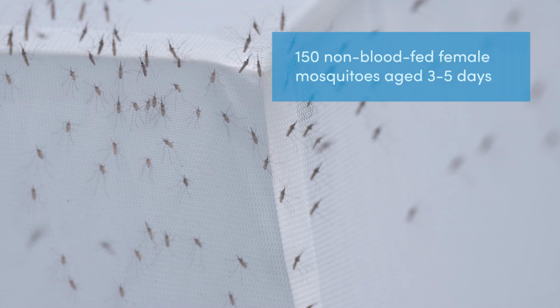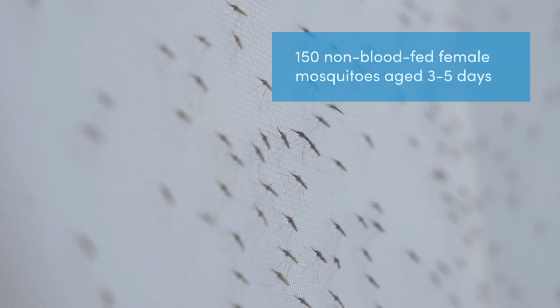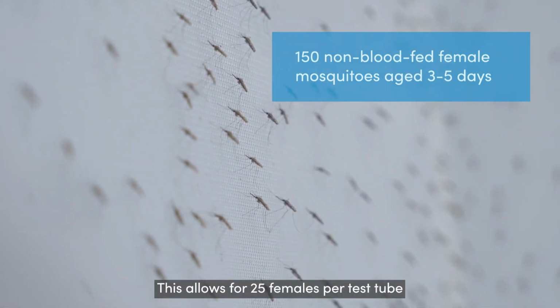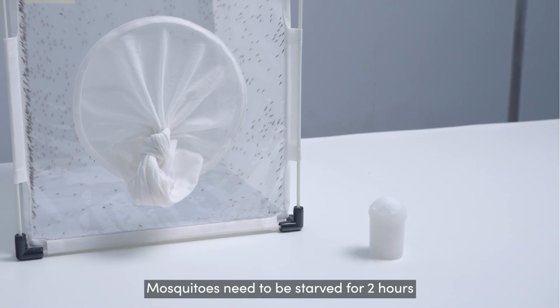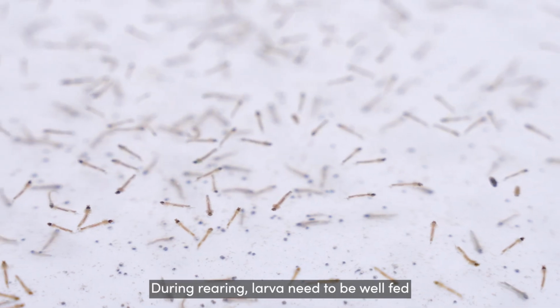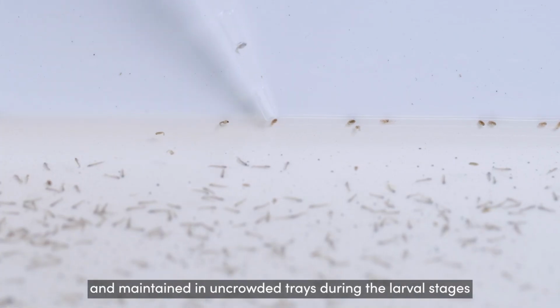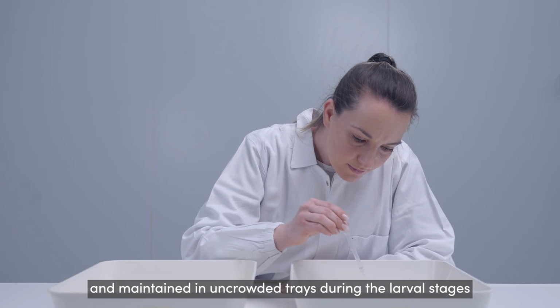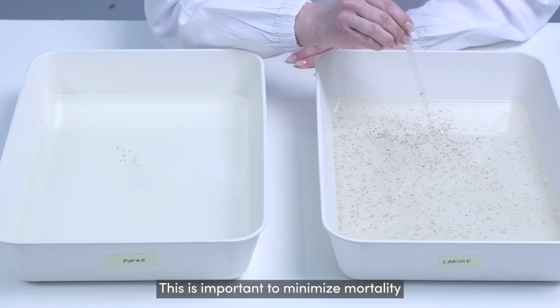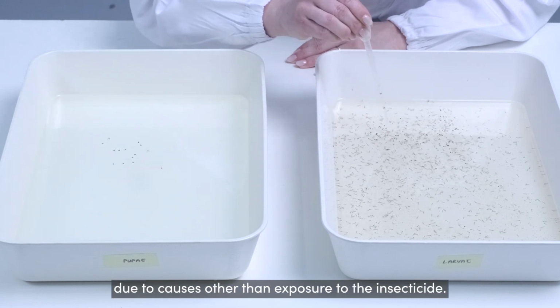This test requires 150 non-blood-fed adult female mosquitoes aged 3 to 5 days. This allows for 25 females per test tube. Mosquitoes need to be starved for 2 hours before using them in the test. During rearing, larvae need to be well fed and maintained in uncrowded trays during the larval stages and in uncrowded cages during the adult stage. This is important to minimize mortality due to causes other than exposure to the insecticide.